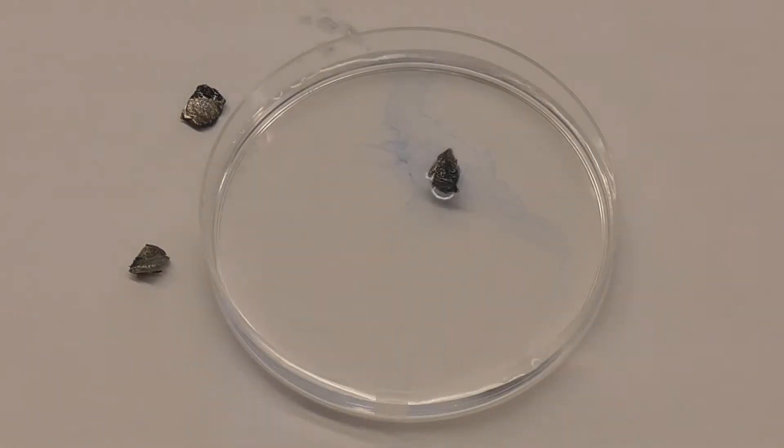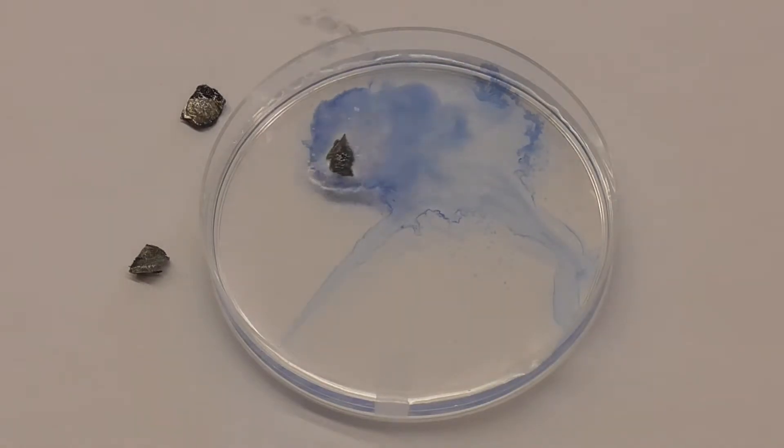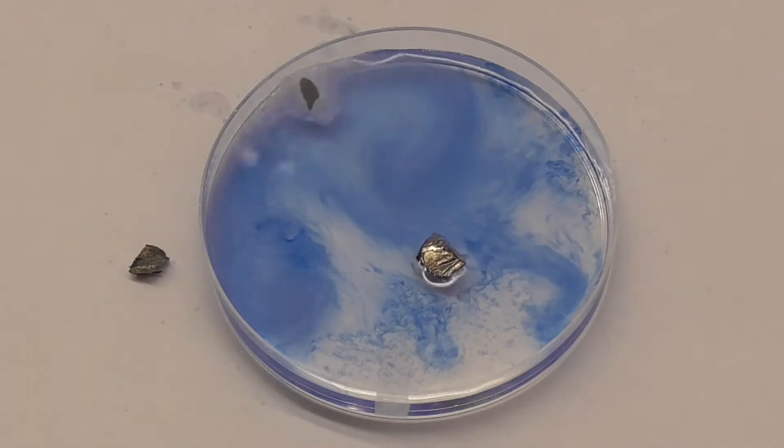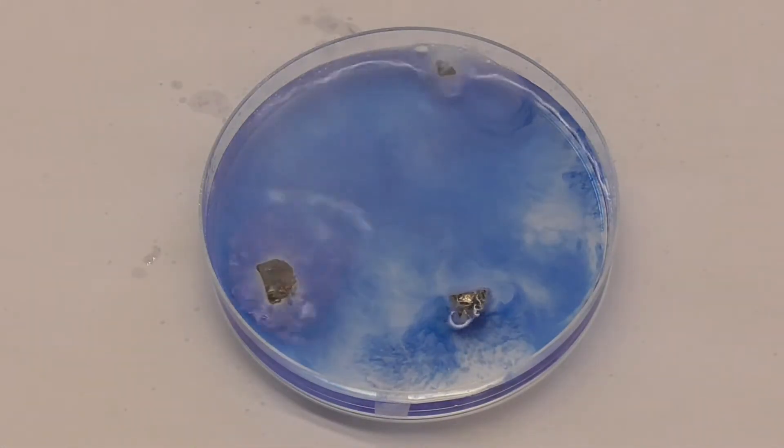Let's add our shavings of lithium metal and watch what happens. Well that didn't take very long. I already see the blue color which tells me a base is formed. Lithium is an alkali metal alright.